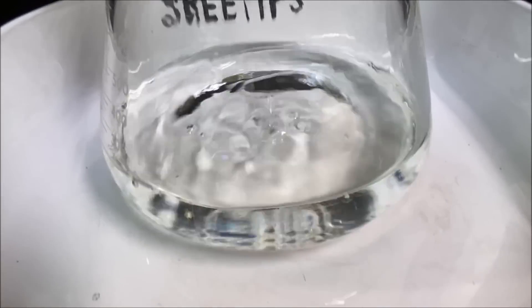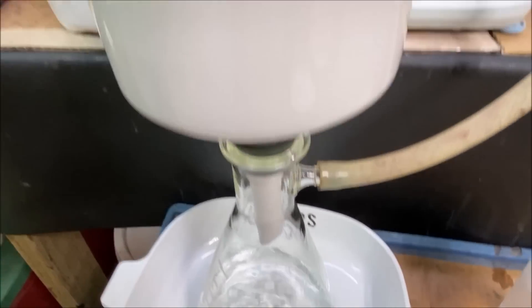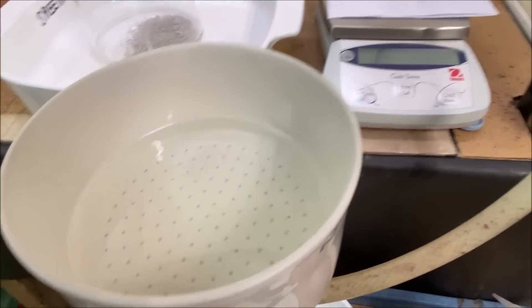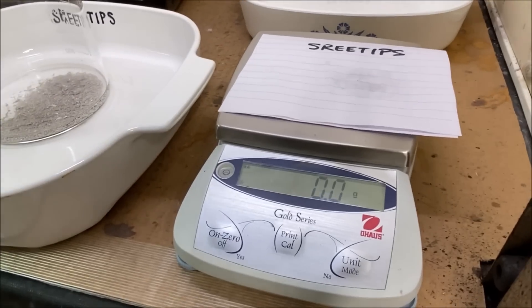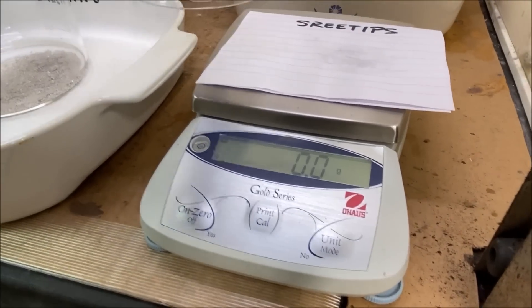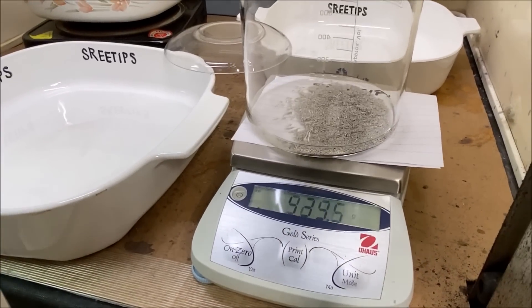Here's our silver nitrate solution, crystal clear and colorless like water. And while it's pulling through that filter, what I'm going to do here is we're going to tare this beaker to zero.